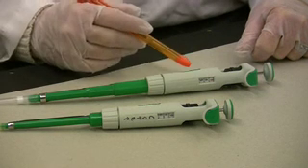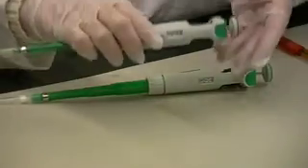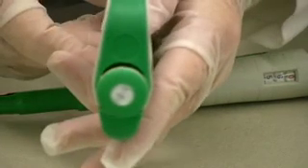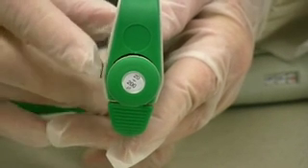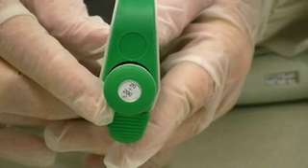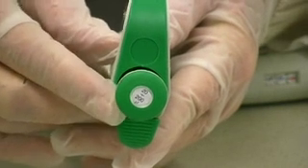Today we are demonstrating two micropipetters. This particular micropipetter is referred to as a P200. If you look at the top of the plunger button, you will see that the range is between 20 microliters and 200 microliters.